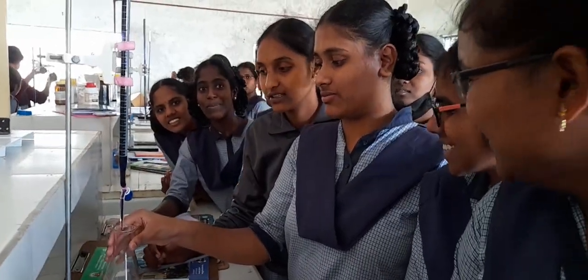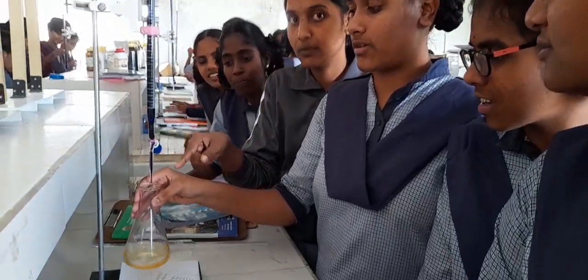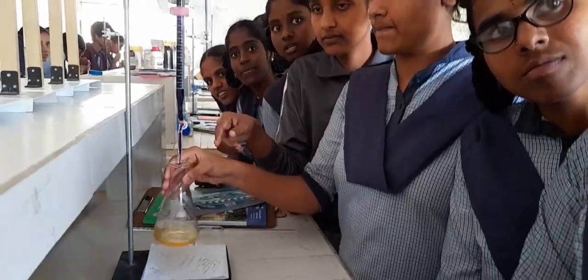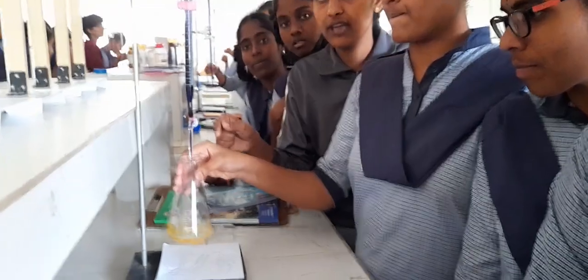Okay. Tell me, Nana, what is your practical about? Ashwita is here. Potassium permanganate in the burette, ferrous ammonium sulfate in the conical flask. Yeah, you have pipetted it out. Right? So what did you add after taking that ferrous ammonium sulfate?